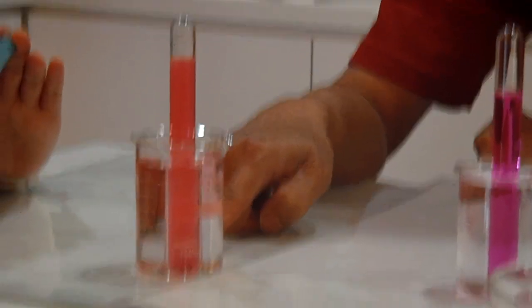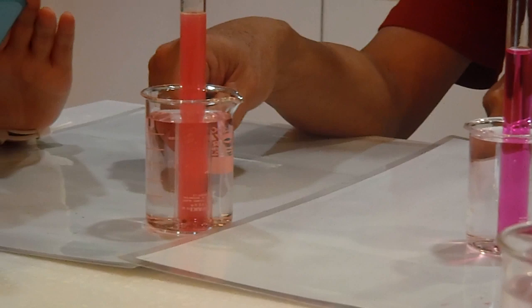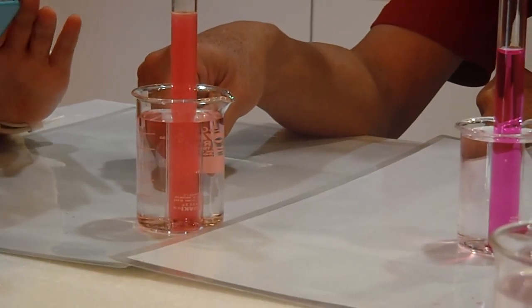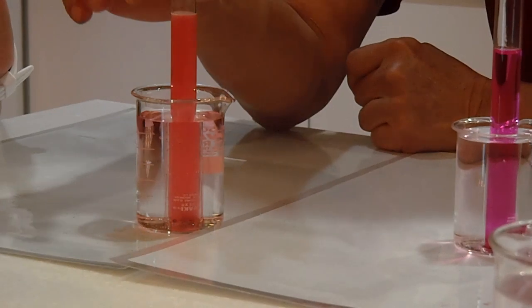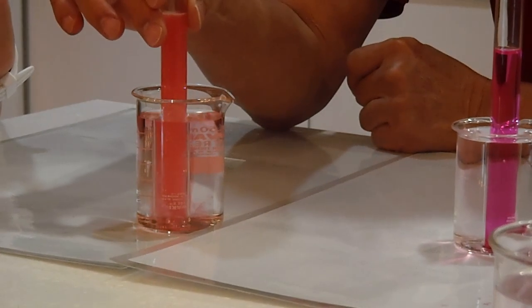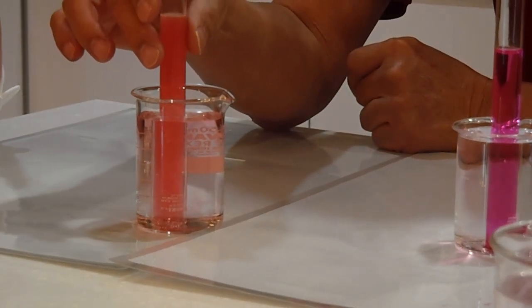So this one red tends to what color? Pink. Yeah. Red tends to pink. Light pink. Okay. This will take a little bit of time to change color.